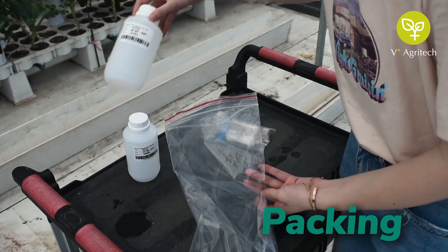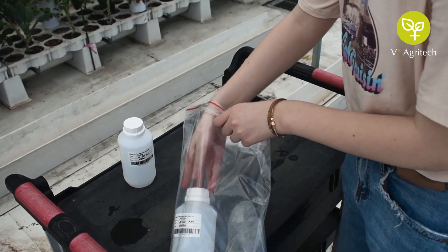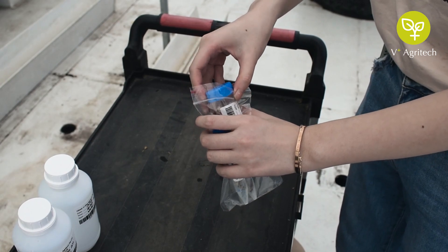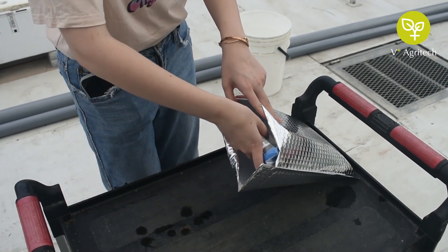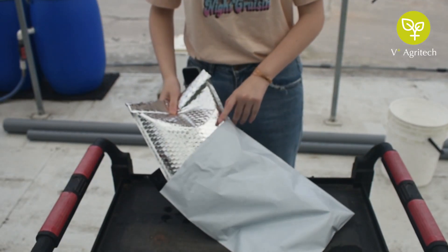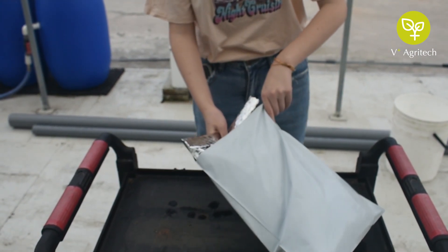Finally, let's pack the items. Place the two bottles into the big resealable bag. Place the tubes into the smaller bag. Now, put all the samples into the aluminium envelope. Seal it tight. Put the envelope into the packaging bag and remember to attach the return label.